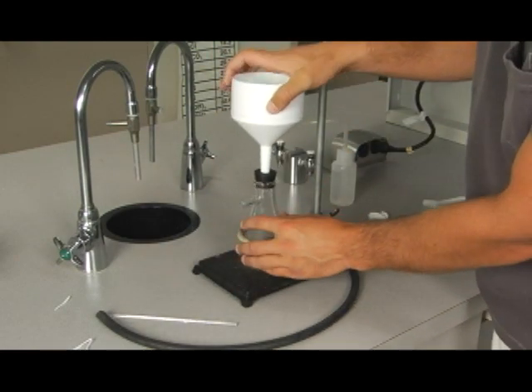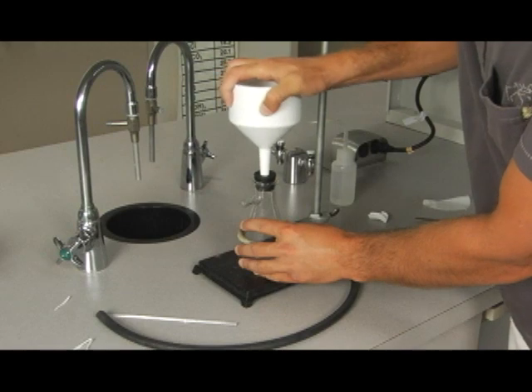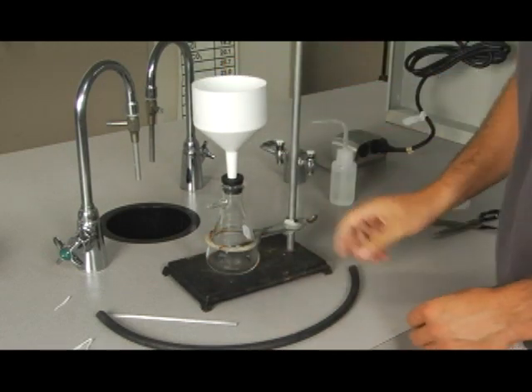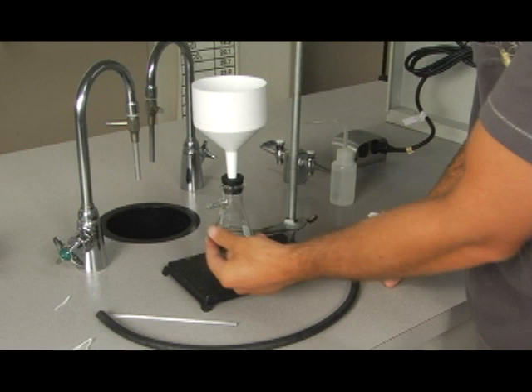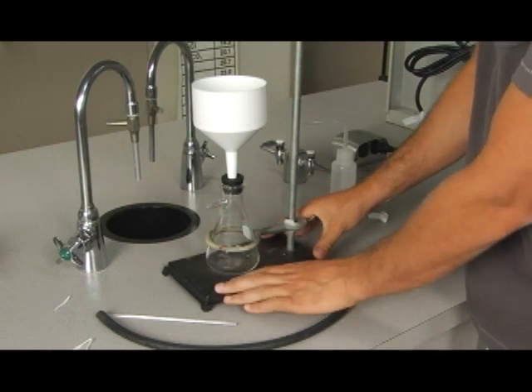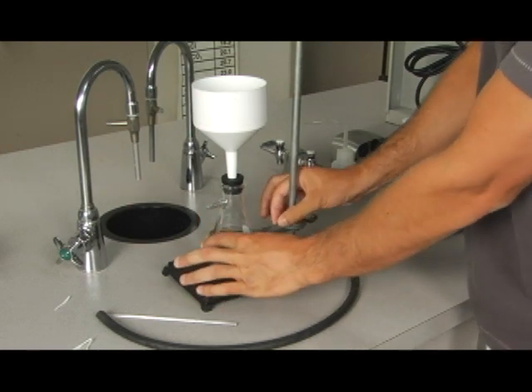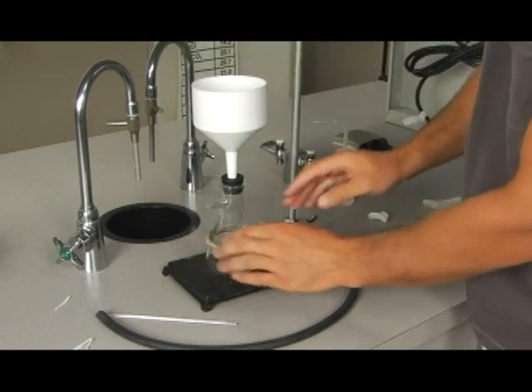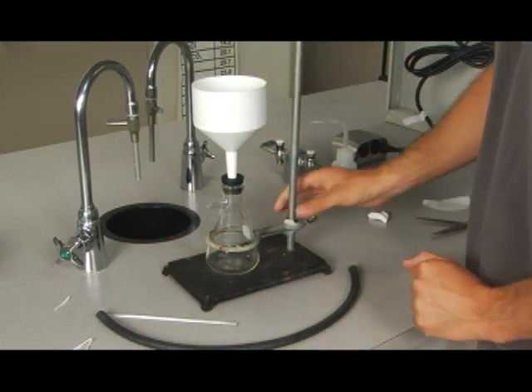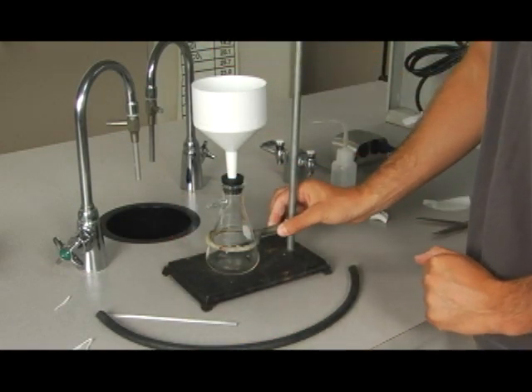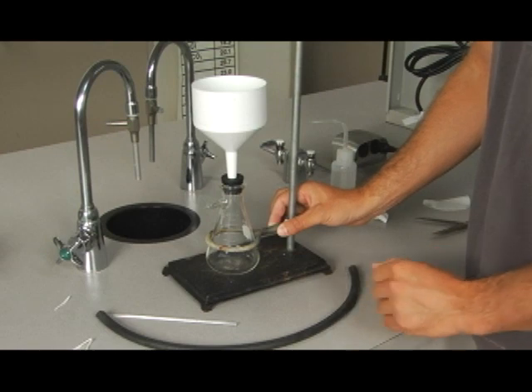Next we'll fit our rubber stopper to our Erlenmeyer flask. The Erlenmeyer flask is a little different than the ones we've seen before. There's an outlet valve here. I placed it in this assembly to hold this down because this whole thing is kind of heavy and the Erlenmeyer flask will tip over. So using this ring stand to hold the flask down is going to be helpful to us.